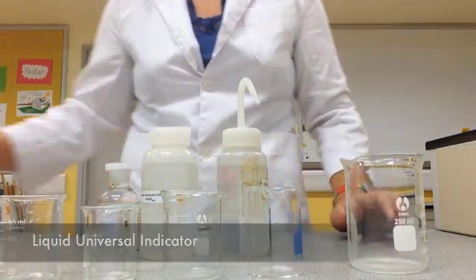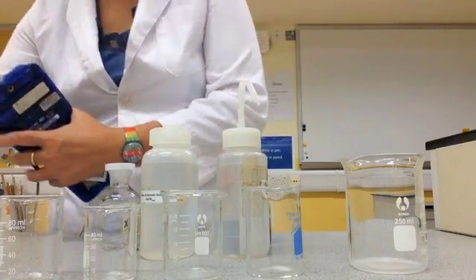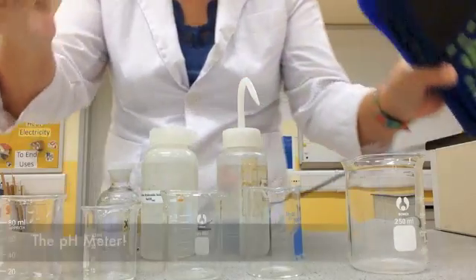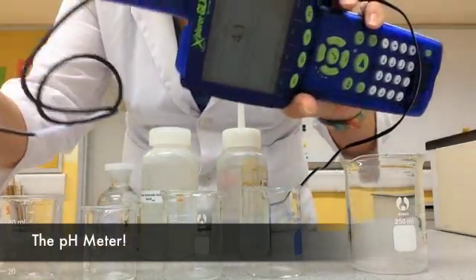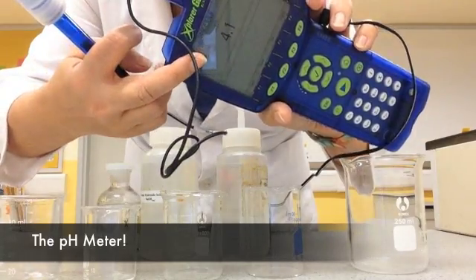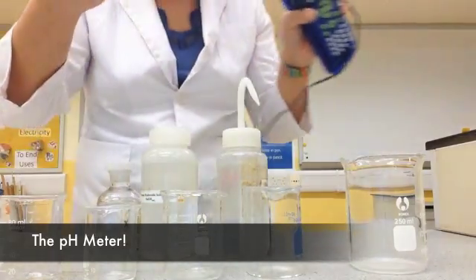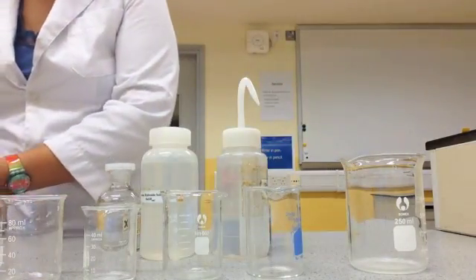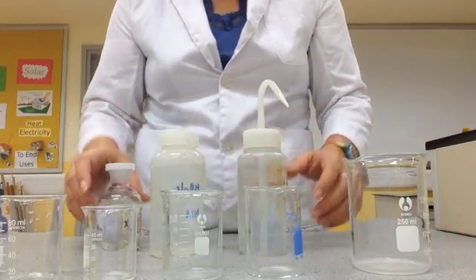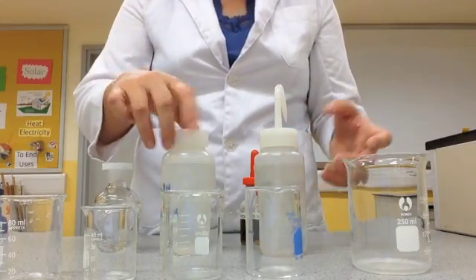In addition to all those things, today I'm also going to show you what we call a pH meter. A pH meter tells you the exact pH, even to the decimal. We are going to experiment on all of this.